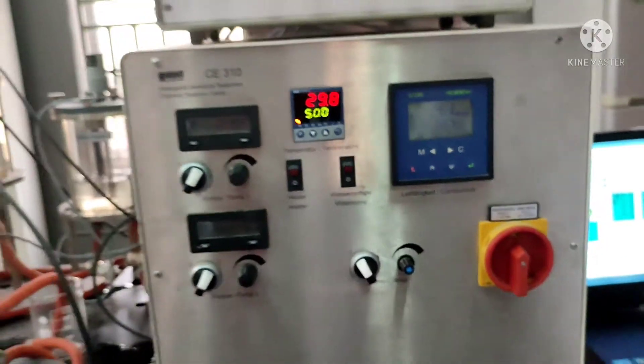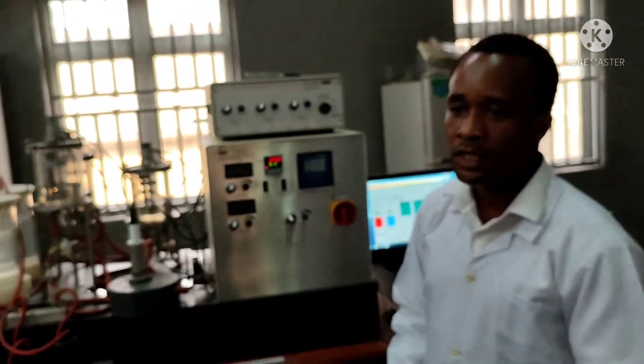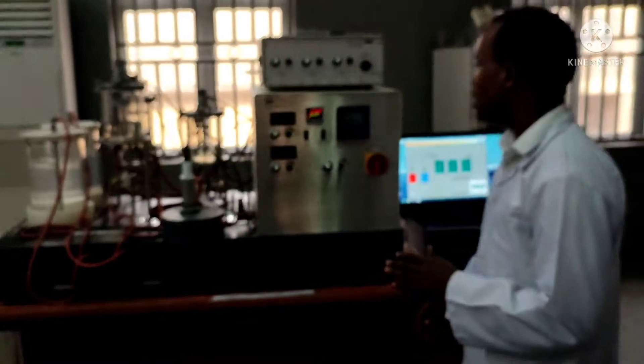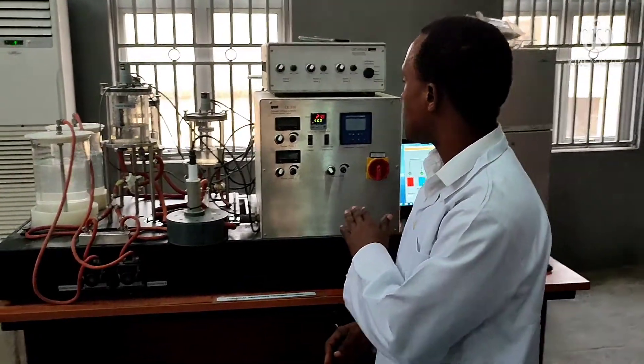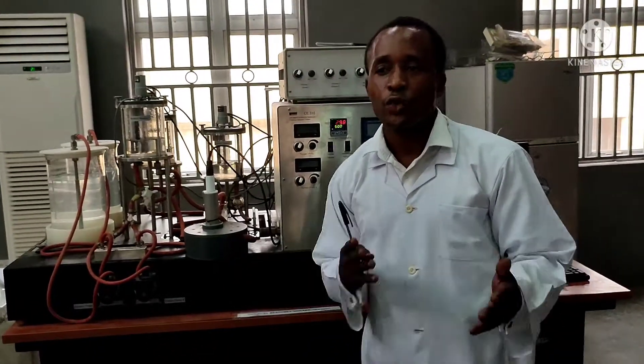That's clearly how to measure the conductivity, and then you can translate it to conversion. We are meant to do this experiment at various parameters in a stipulated manner. After that, you correlate your readings with graphical analysis to show which reactor offers the highest conversion, and you can also determine the overall conversion of the system. Thank you very much.